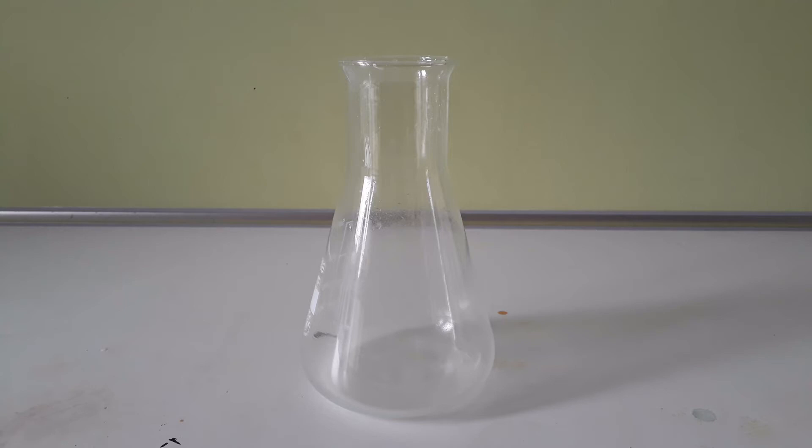Hi, in this video I am going to take a look at a pretty rare class of compounds called peroxides. Or rather, one particular peroxide which is rather easily prepared, calcium peroxide.